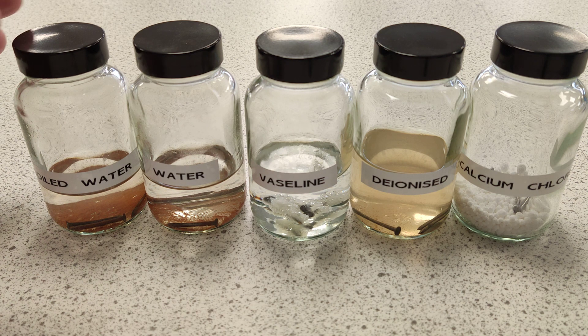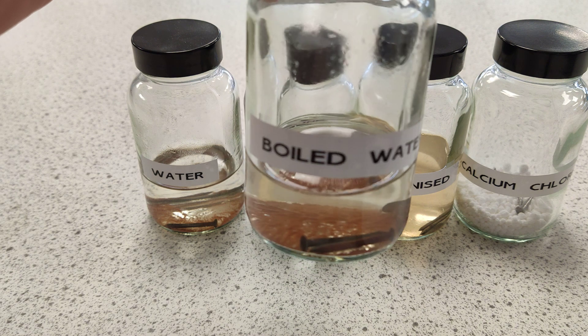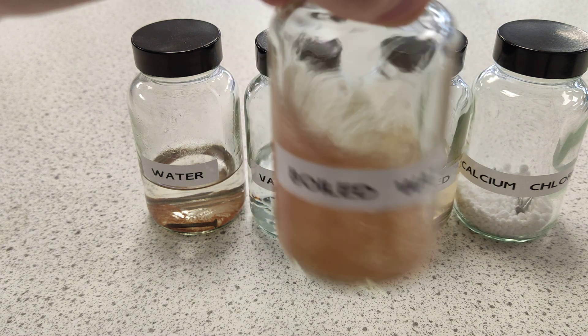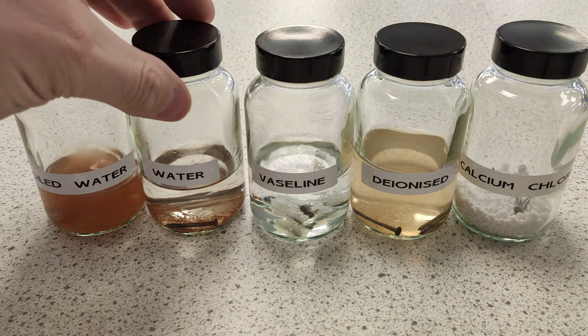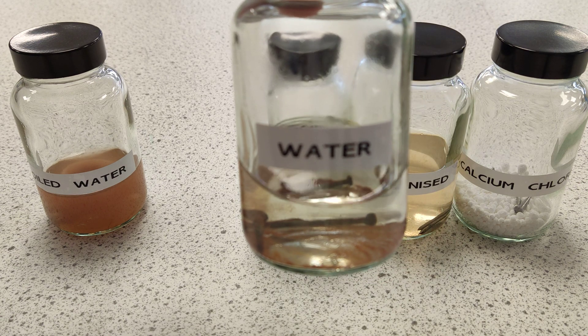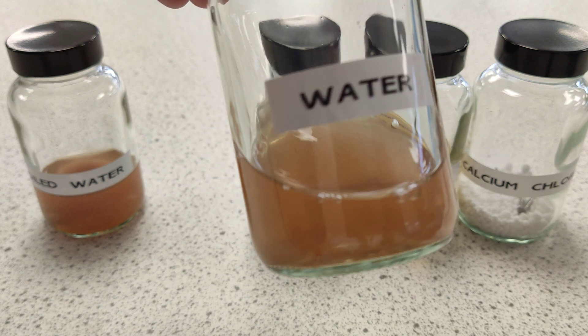Let's have a little look - I'll give you a close-up so you can have a comparison. We took some water and boiled it, and there you go, you can see the nails. I can give it a shake and it looks pretty rusty. Standard water there - give it a little shake. That's definitely rusted.